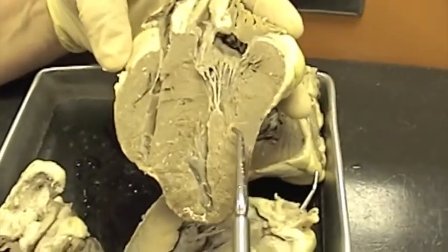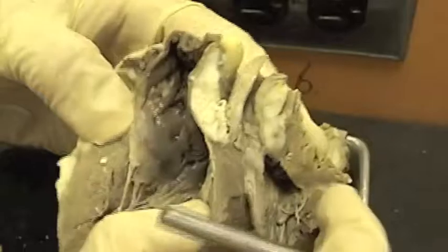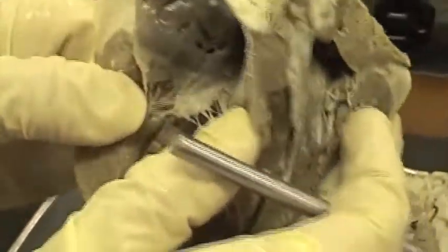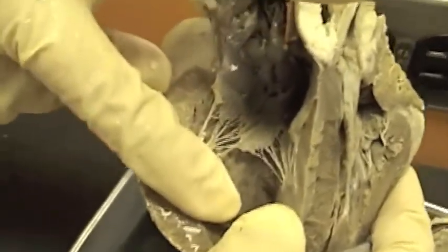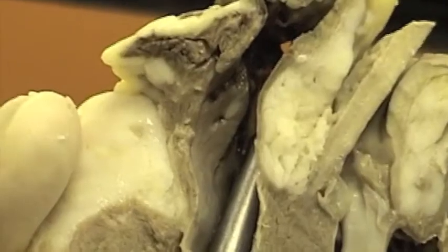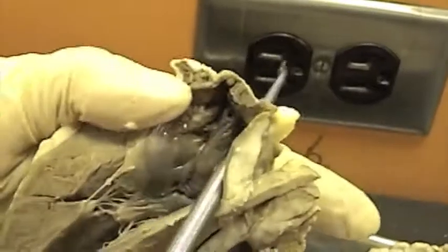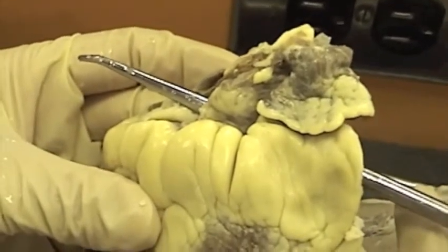Here's a different heart section. Here is the left ventricle. Down here is the right ventricle, here is the tricuspid valve — you can see the connective tissue flaps — and above it is the atrium. Now we're looking for the great vessels associated with the atrium. The probe is in the right atrium, going through a blood vessel that has been cut. That is the superior vena cava. There is another one going more laterally — that is what's left of the inferior vena cava.